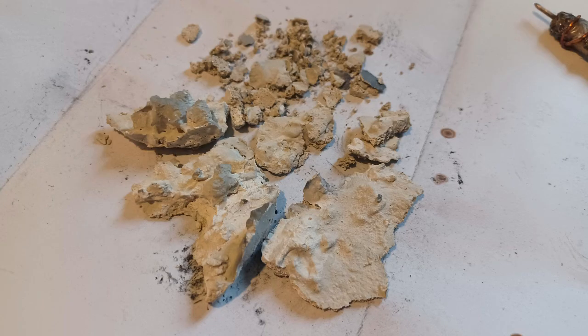The starting material is dry silver chloride I had baked at 200 degrees Celsius. Because I know some of the methods I'll be testing have large losses, I will only use one gram of silver chloride at a time. It should be enough to show us how effective a method is while avoiding unnecessary wasting of silver.